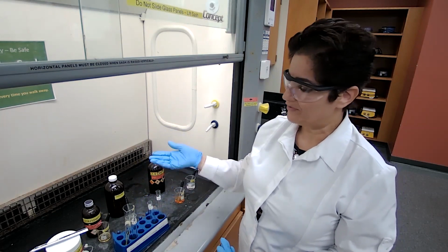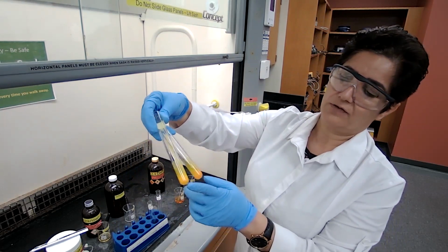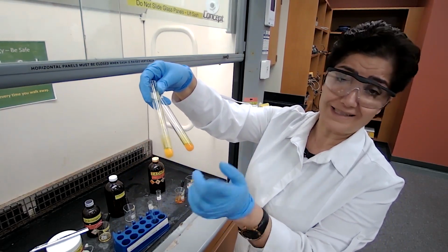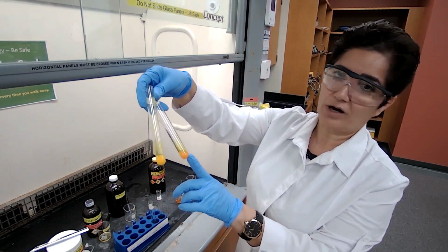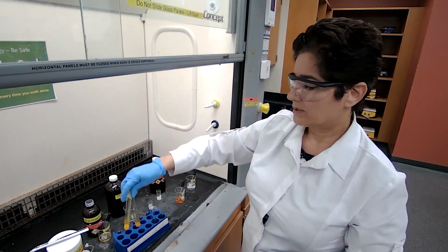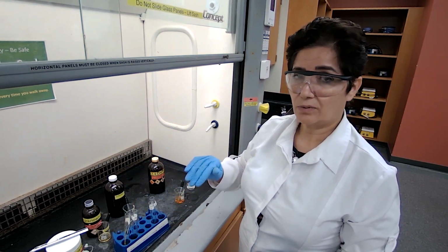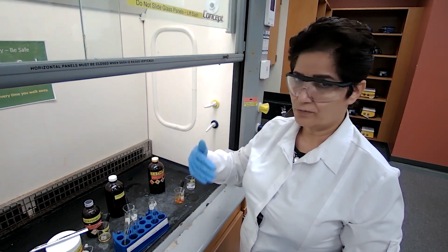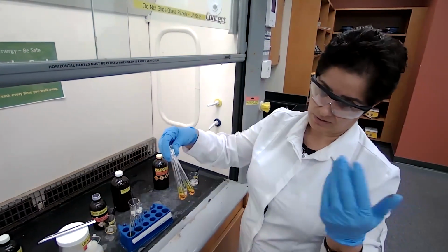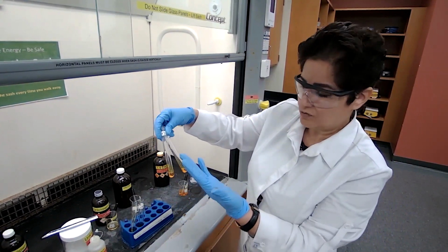This is a very fast reaction. If you have an aldehyde or ketone, it's going to form a precipitate. And the color of the precipitate can be anywhere from light yellow to dark orange, depending on the aldehyde or ketone. I will keep this in the hot water, and I will show you at the end of this video if it did form, and if it doesn't form, it doesn't form.